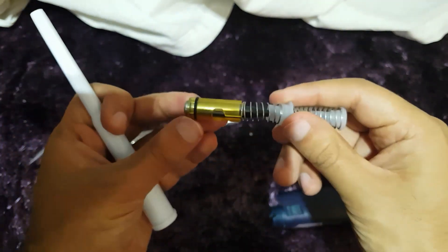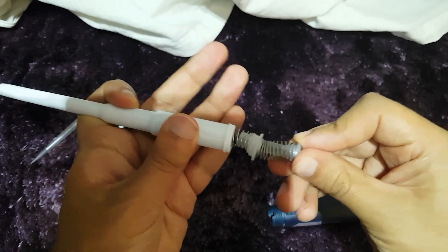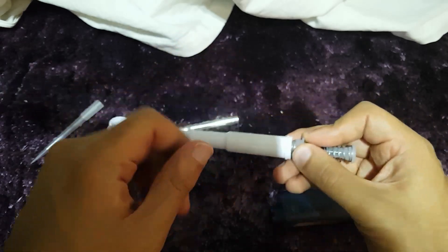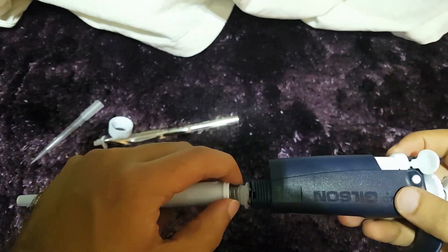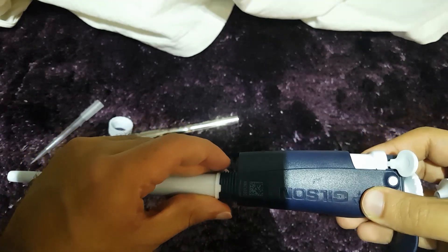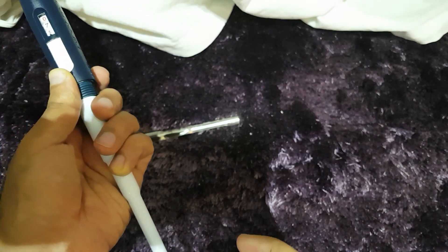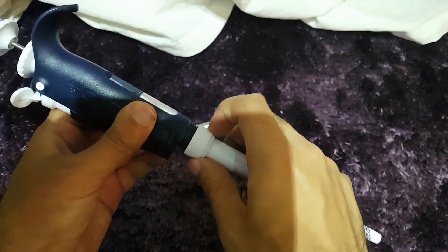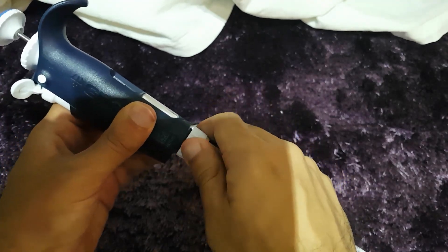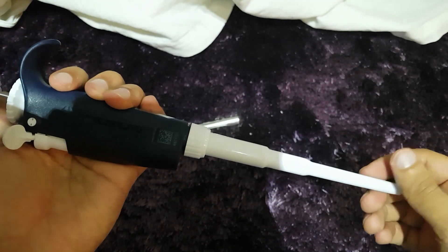Here is the air chamber inside the pipette. What we're going to do is simply push this into there. You just take the end of the pipette and push it through here. Then you take this here and simply screw it back into place, making sure it's screwed up nice and tight — as you can see, it's screwed up nice and tight there.